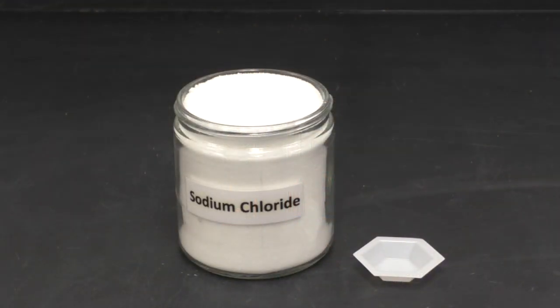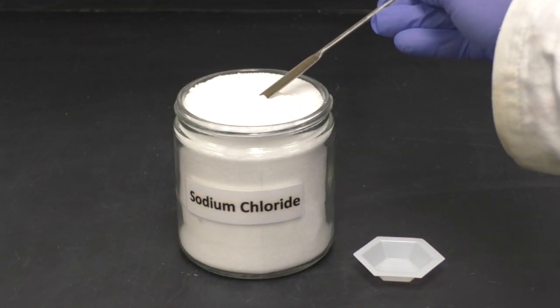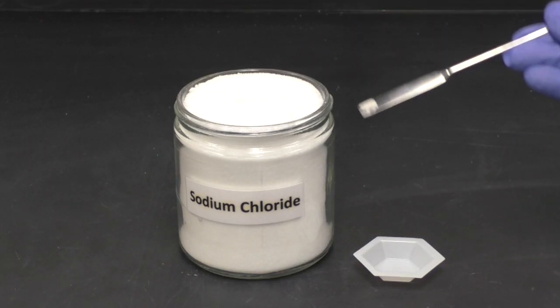And for solids, you should use a spatula. Using the small side of the spatula can help you limit the amount of solid that you use.